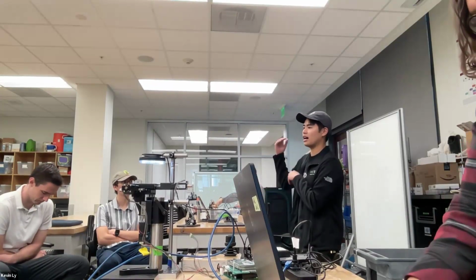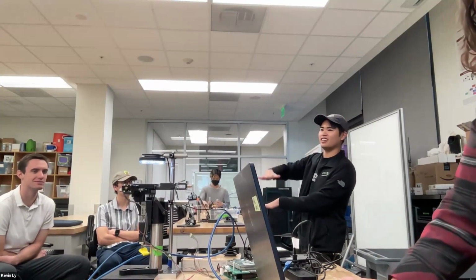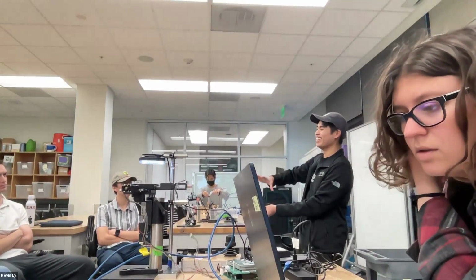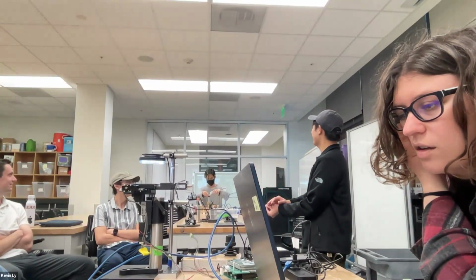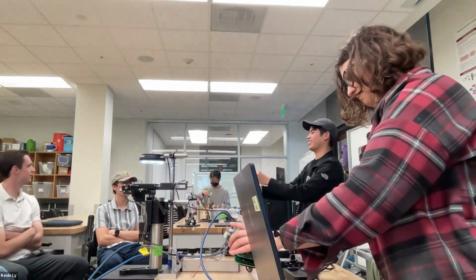Sometimes they sit a little higher, in software land. But I would say it's a middleman, because there are two ends, but there's a lot of middle. There could be a lot of layers of drivers. Right, Ethan? Yes. There could be a hardware driver or a driver for the software to hardware.